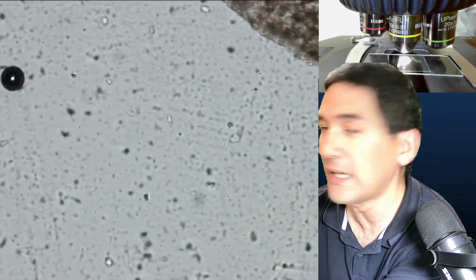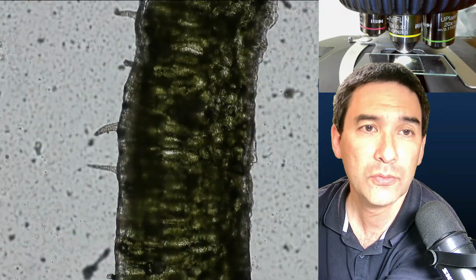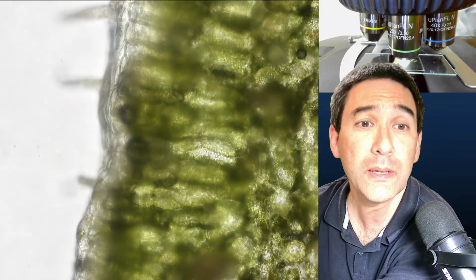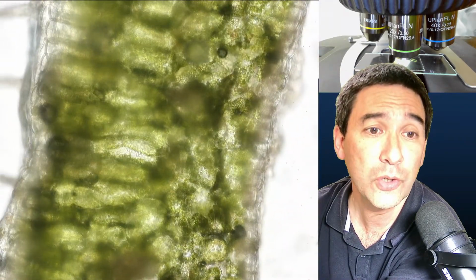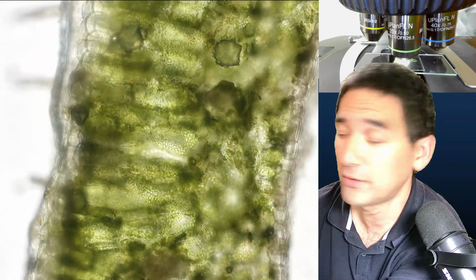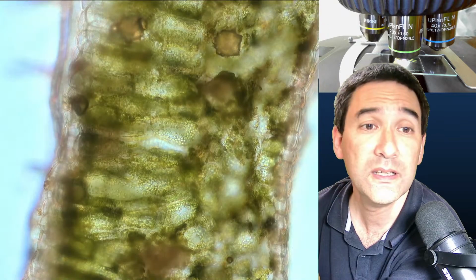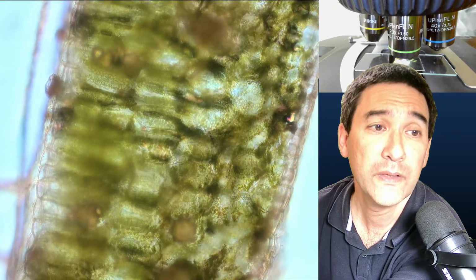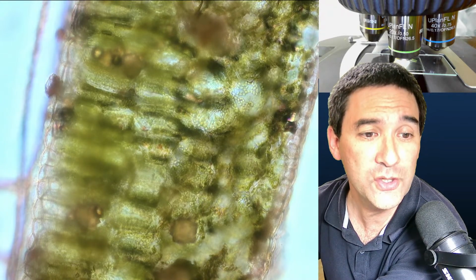But now let's have a look at the leaf, which is, where is it? Here. Okay, maybe you remember last week or no, 2 weeks ago or so, I also put some leaves under the microscope here. And I talked a little bit about the leaf structure as well. Some of you might remember this. Let's do it like this. Yeah, and I already talked a little bit about the palisade mesophyll and the spongy mesophyll.